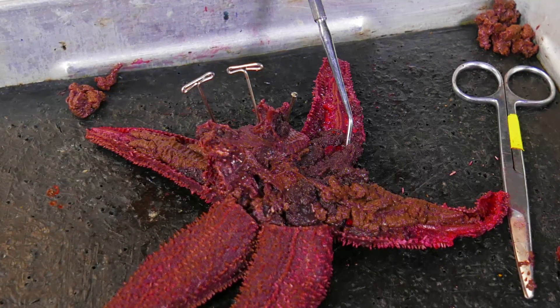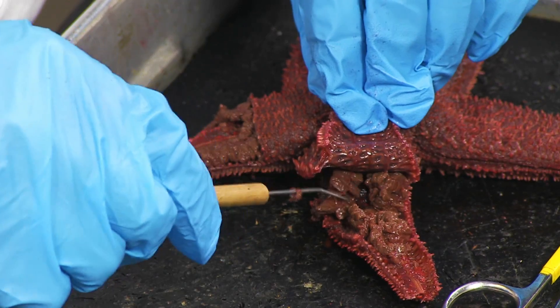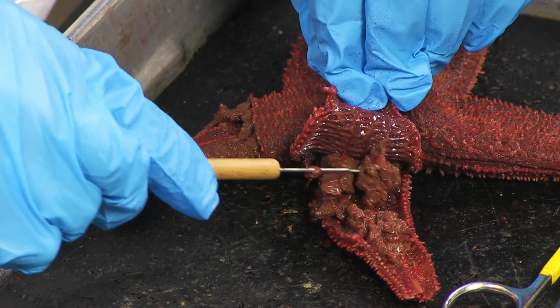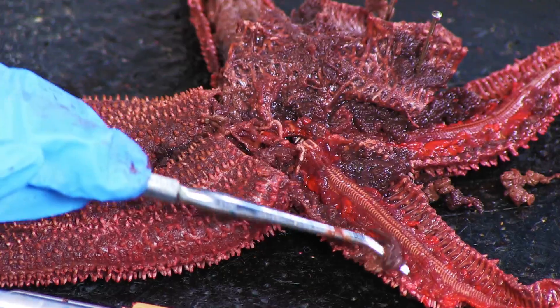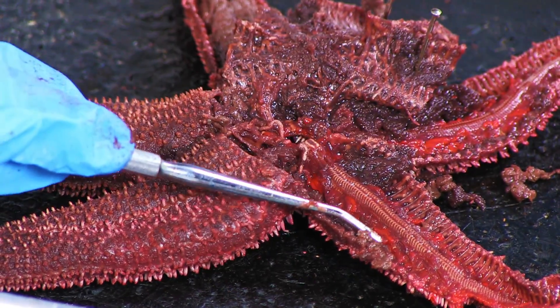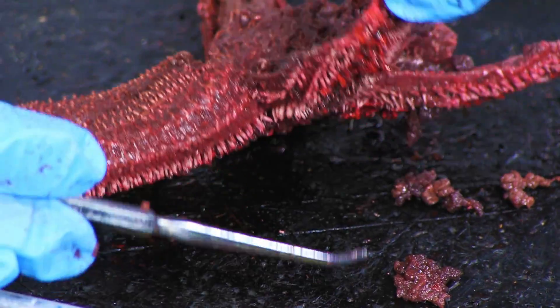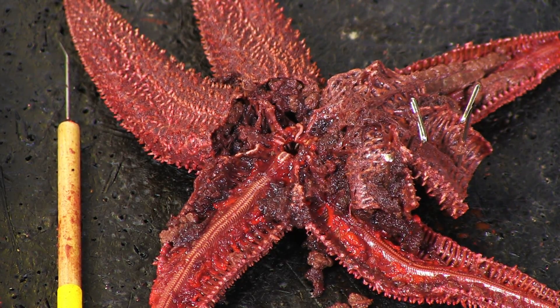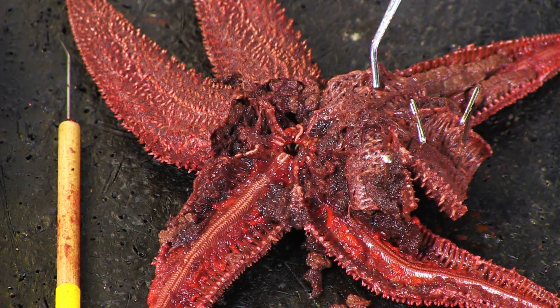The gonads are structures involved in sexual reproduction and appear clustered and arranged like grapes. In another arm, both the pyloric cecum and the gonads are removed. Observe the ampulae of the tube feet which lie in the ambulacral ridge. These appear jelly-like or like small bulbs which connect with the podium of the tube feet.